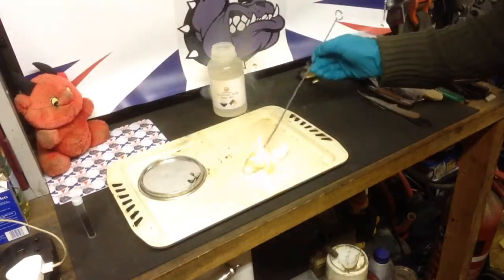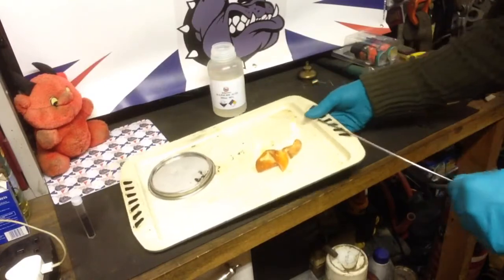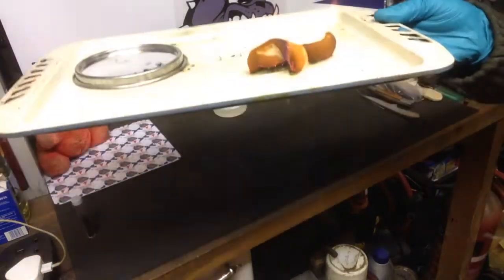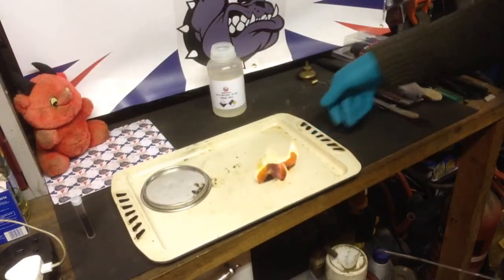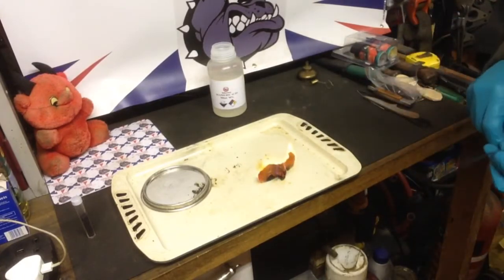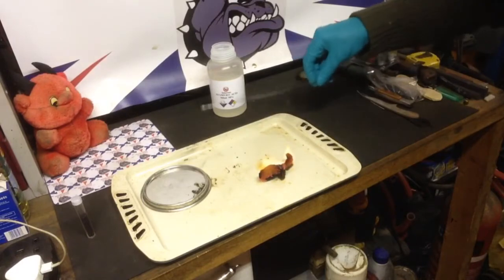As you can see, it bursts straight into flames quite violently. It's a little chemical fire that's very easy to do. But this stuff — when you mix sulfuric acid with potassium permanganate — is very, very oxidizing and very unstable.